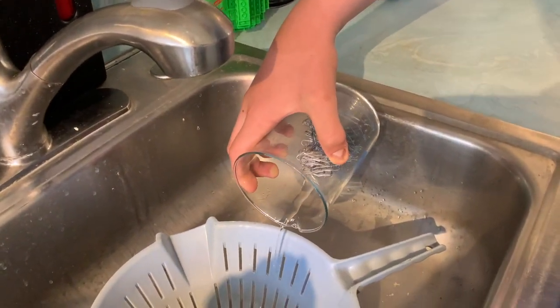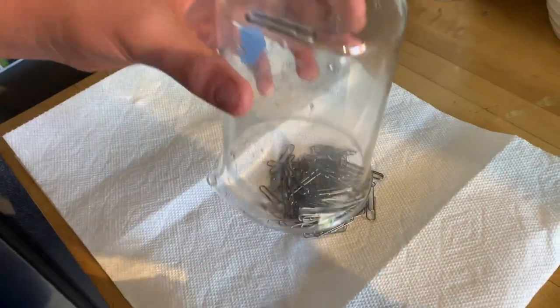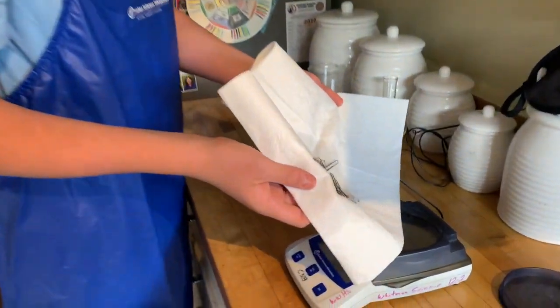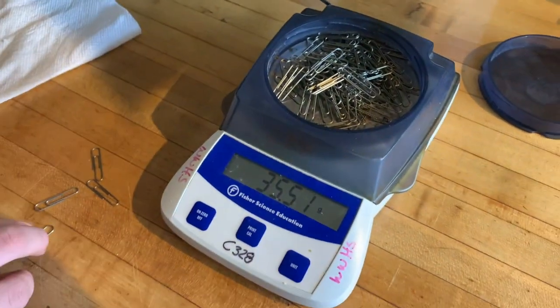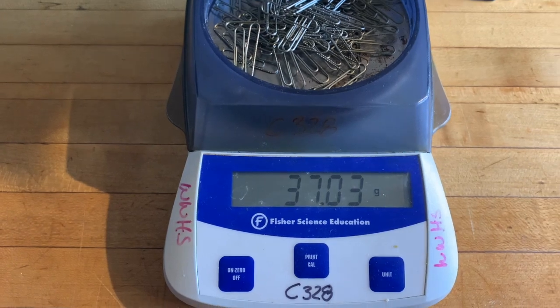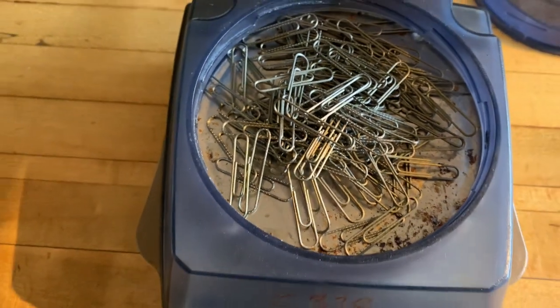At this point we are pretty confident that the acid is gone, but we've saved all of our paperclips. We're now going to get as much liquid off as possible and pour these onto a paper towel. We really need to make sure that these dry. We're going to dry these really well and then mass them again. Now that they're dry, it's time to mass the paperclips. Notice the dull appearance of the paperclips compared to how they were — that is the mass of the iron core.